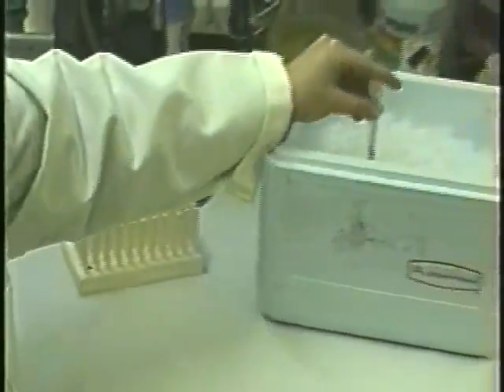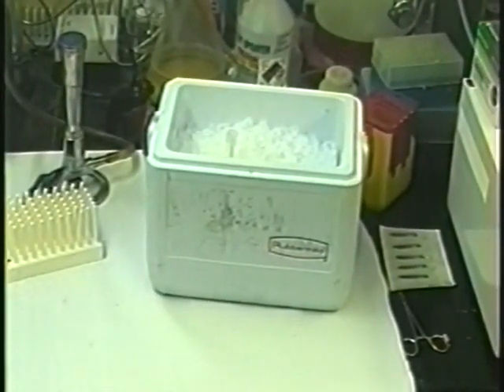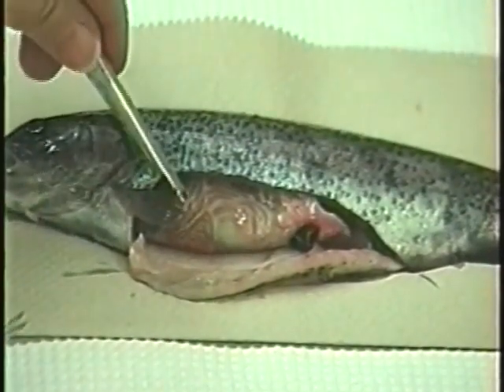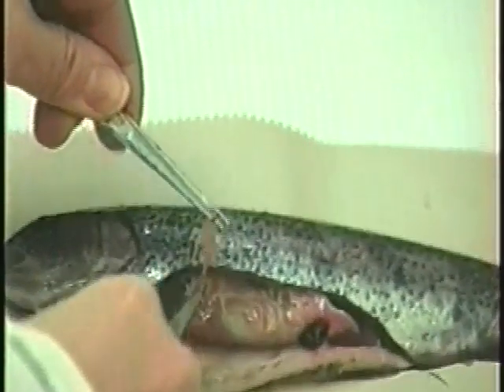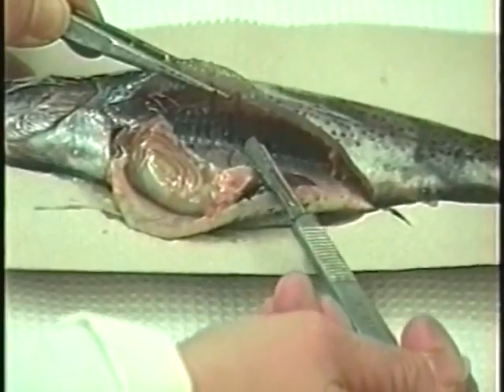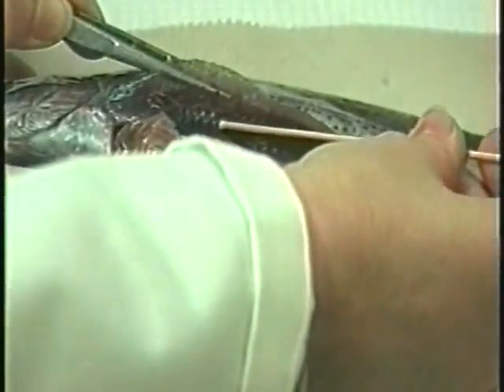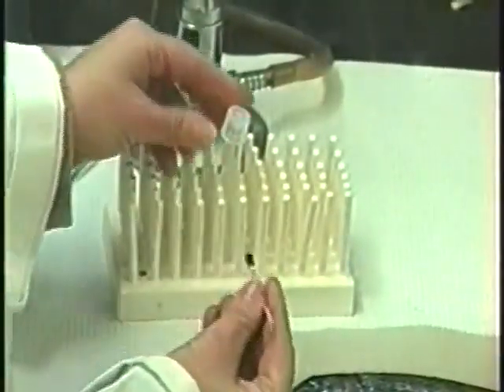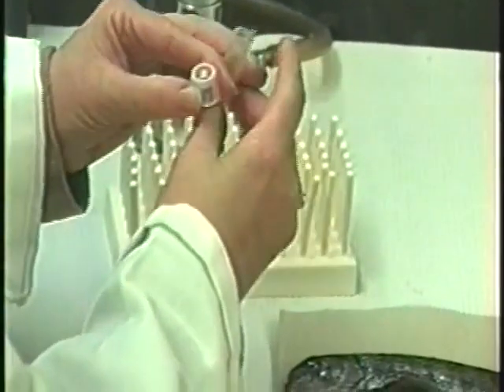Samples collected in the field that cannot be inoculated immediately onto media can be stored on ice for up to 24 hours. The sample may consist of a portion of tissue which has been excised aseptically or taken using a plastic loop or sterile swab. To do the latter, first puncture the kidney membrane with a sterile scalpel and then insert the loop or swab. The swab is then placed in a labeled sterile tube and refrigerated or held on ice until it can be inoculated onto agar.